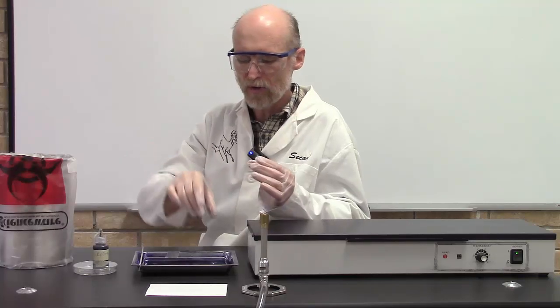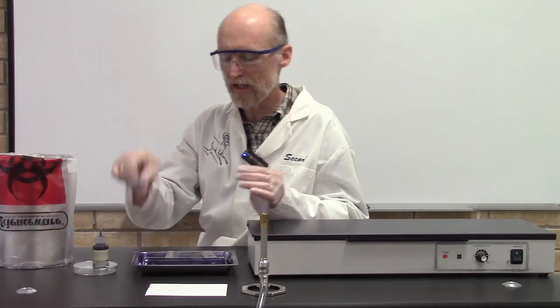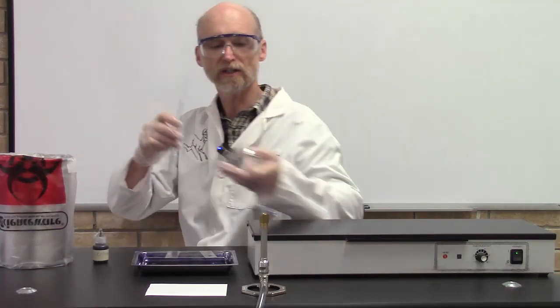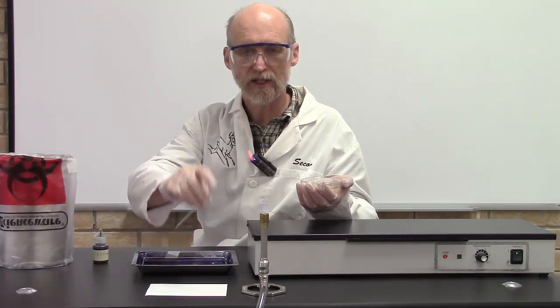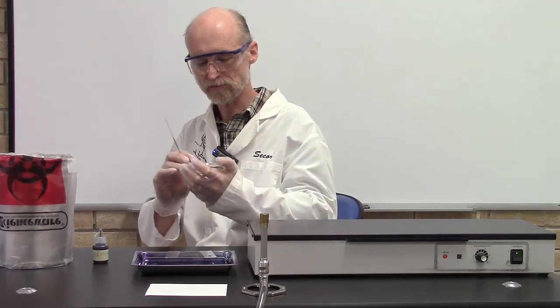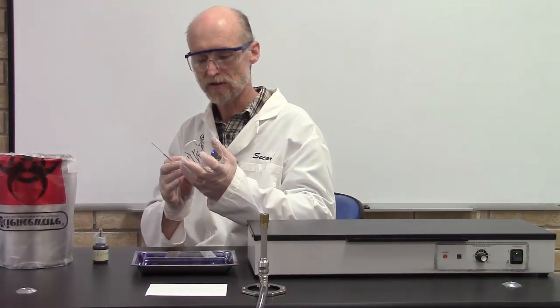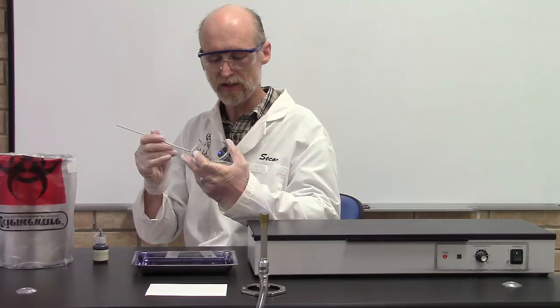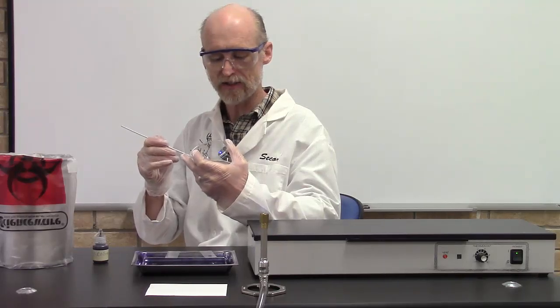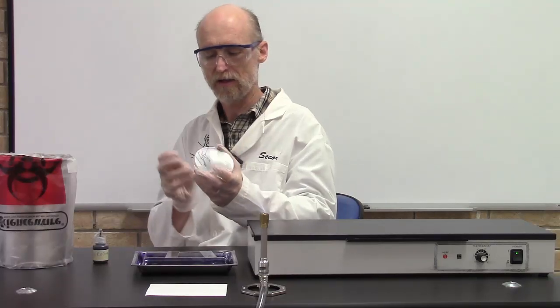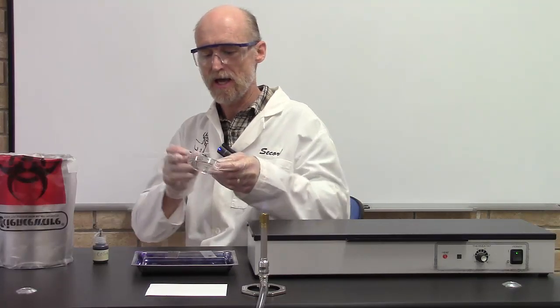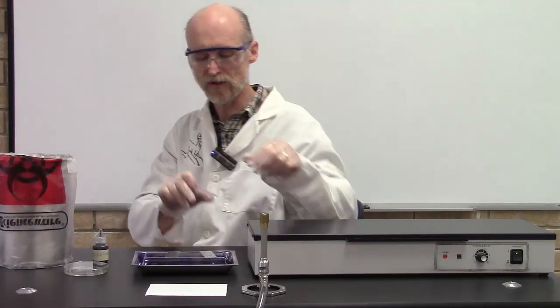Next, we're going to get a culture of bacteria and we're going to stir them into the drop of dye. Let me flame my loop. Sterilize it. I'll let this cool. I'll go in and get me a nice sample of bacteria.